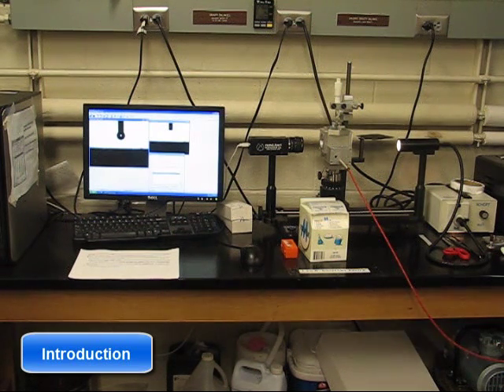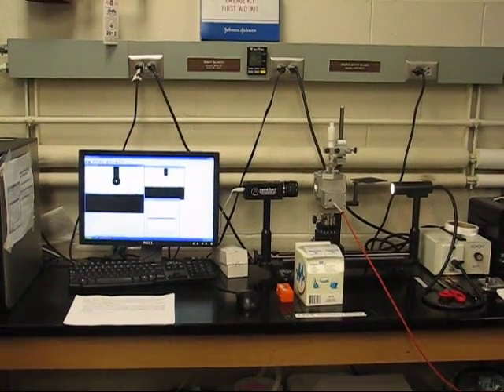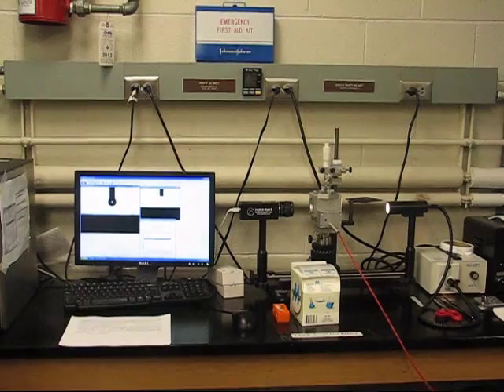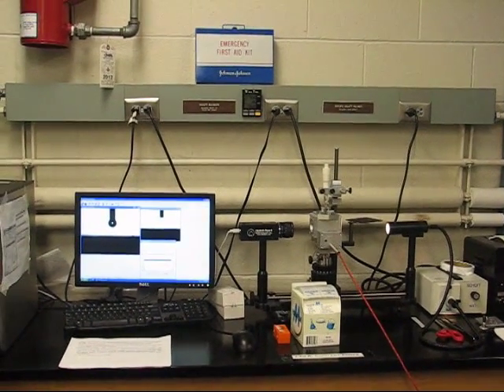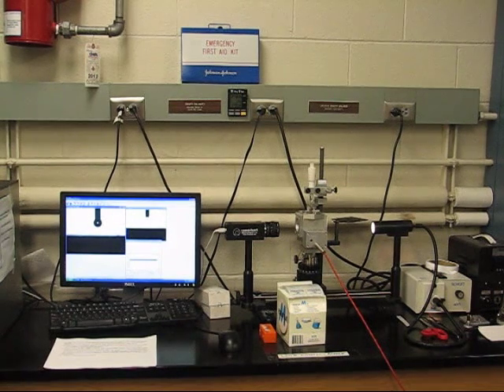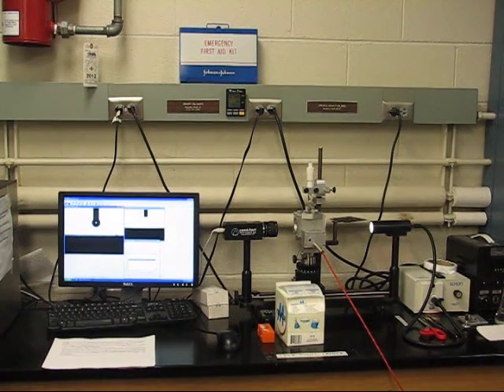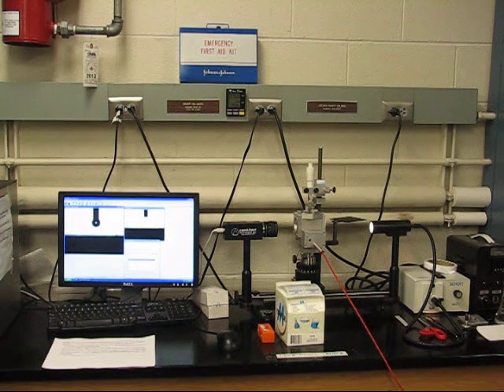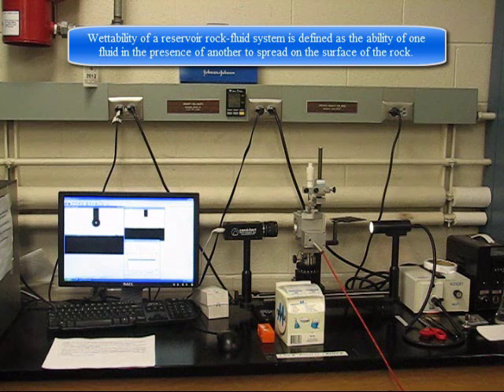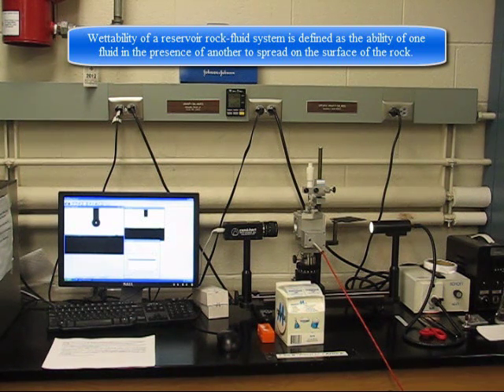In the first case, the liquid will wet the solid completely, whereas in the latter case, a contact angle greater than zero will develop between the surface and the drop. When two immiscible fluids contact a solid surface, one of them tends to spread or adhere to it more so than the other. Wettability of a reservoir rock-fluid system is defined as the ability of one fluid in the presence of another to spread on the surface of a rock.